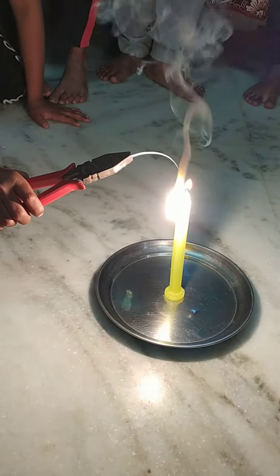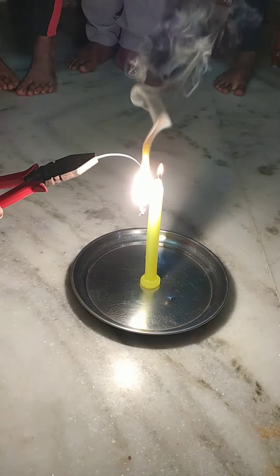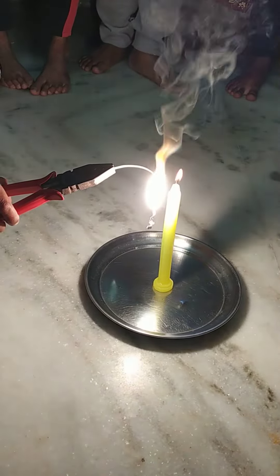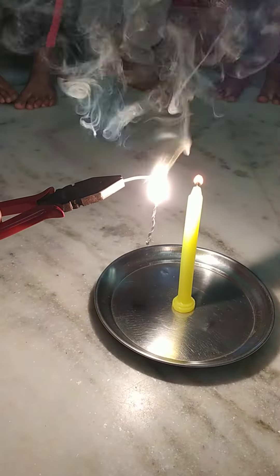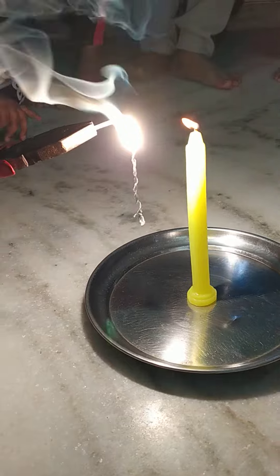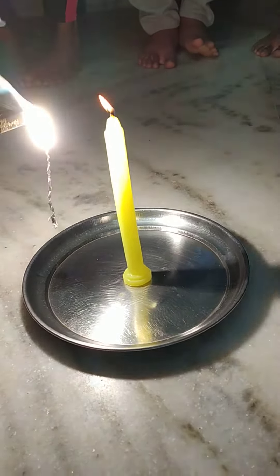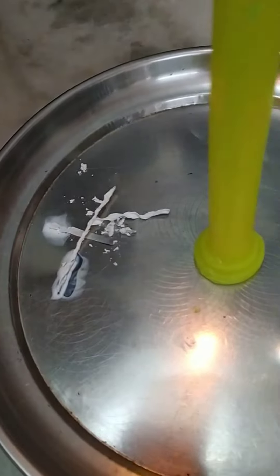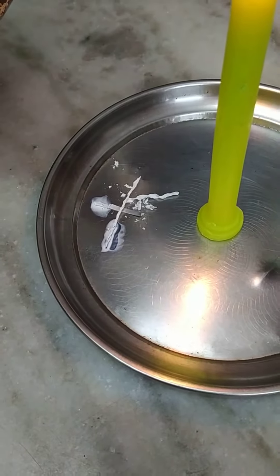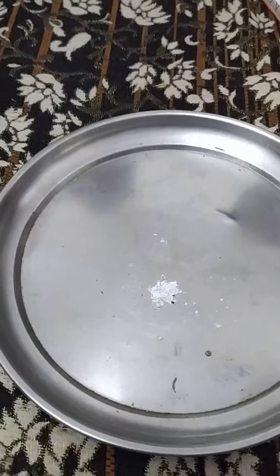So we have to collect that ash. What is that ash? Magnesium oxide. Yes, magnesium oxide — it's a metal oxide, right? You see the white dazzling flame — that's very important. Now we have to test the nature of this magnesium oxide ash.